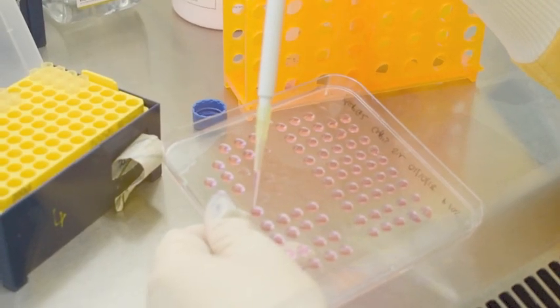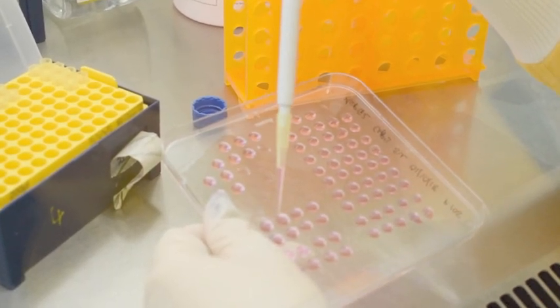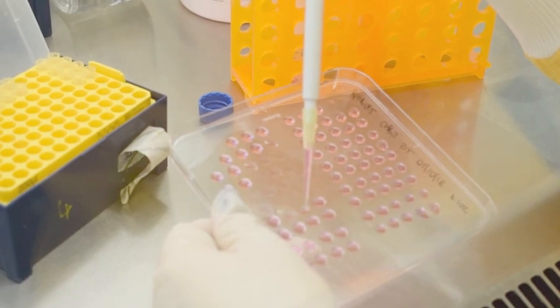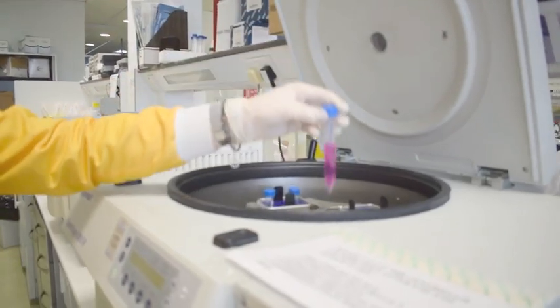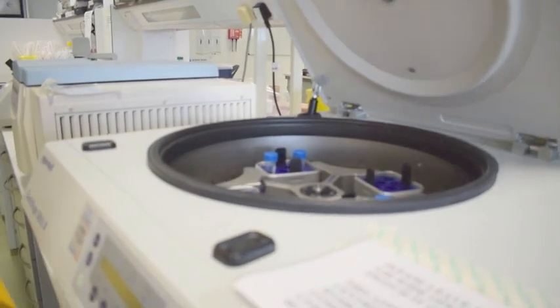To harvest the spheroids, carefully flip open the lid and collect the individual spheroids using a pipette tip. Once they have been collected, the spheroids are then centrifuged.